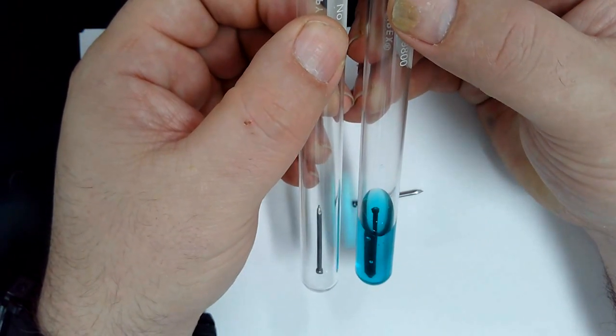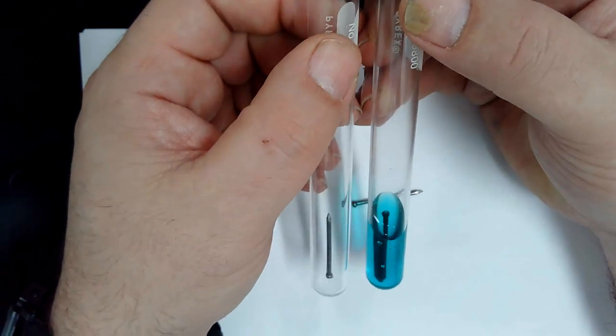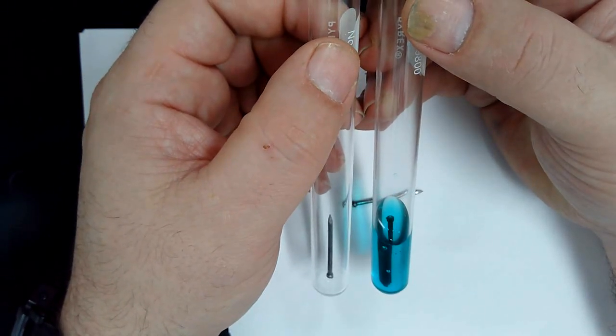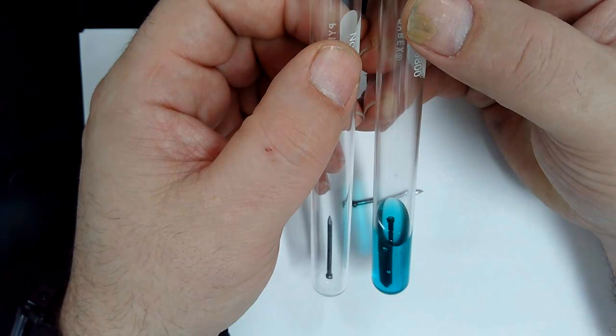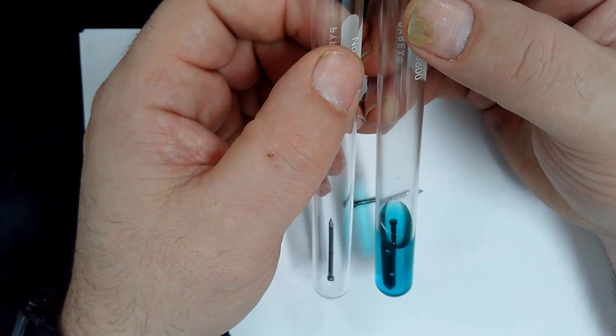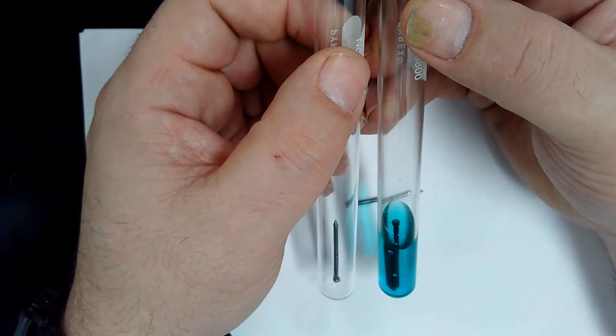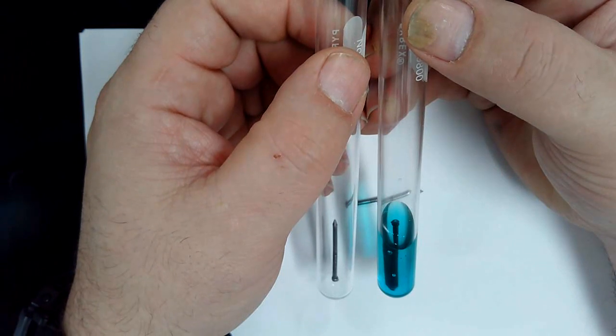Oh, it flipped. Didn't flip. Does it? I don't know. Can't tell. The water's too blurry. It got blurry actually, but it also got bigger. It looks bigger. Why does it look bigger? Go ahead, Carter.